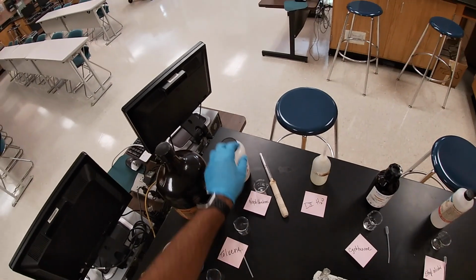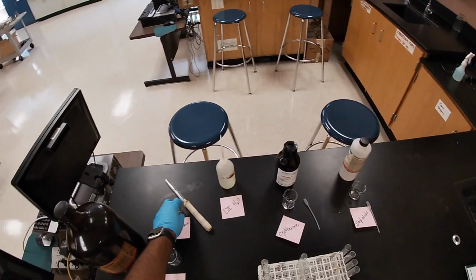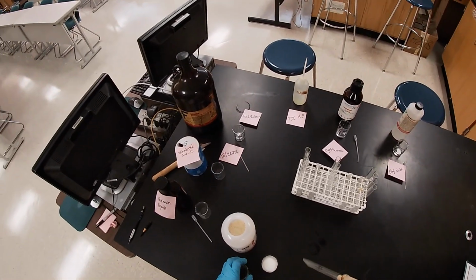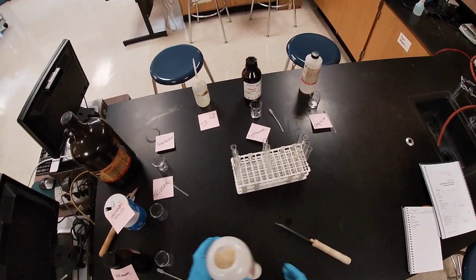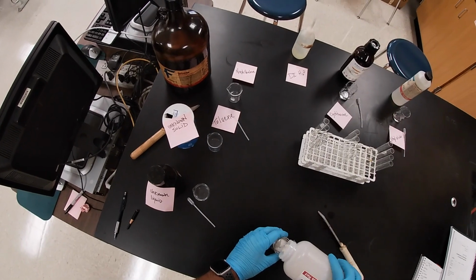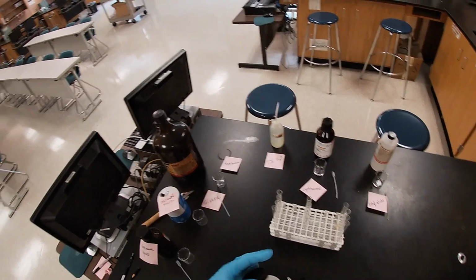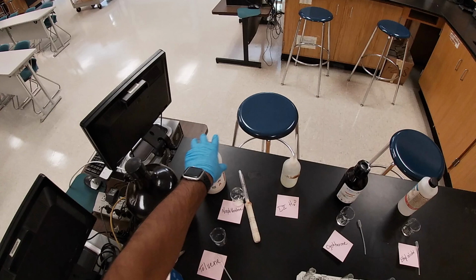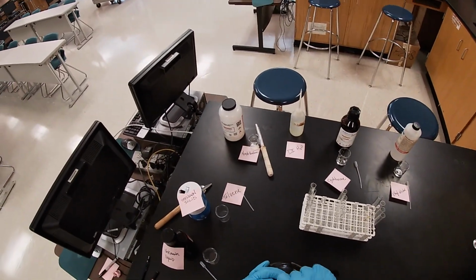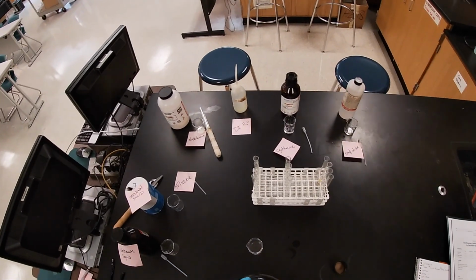The water I'm not even going to mess with. Then I'm going to get some naphthalene. These are mothballs. So if you haven't cleaned out a closet or a drawer in a while, that's exactly what it's going to smell like. Whew. Smelly. Wow. Some people say it smells like old people.